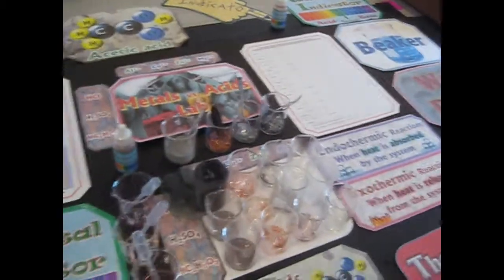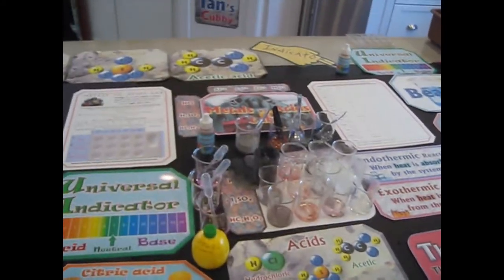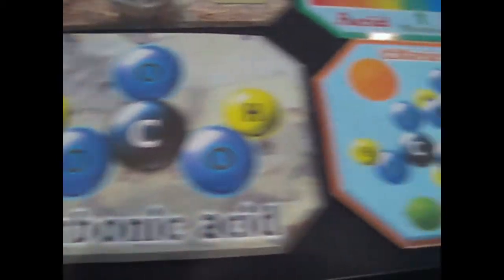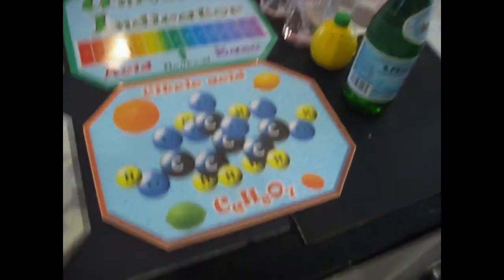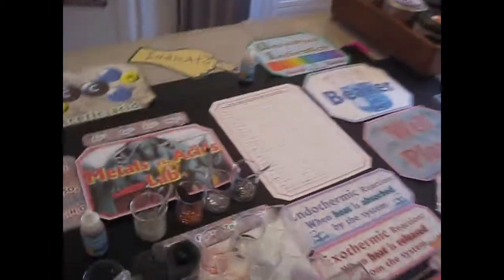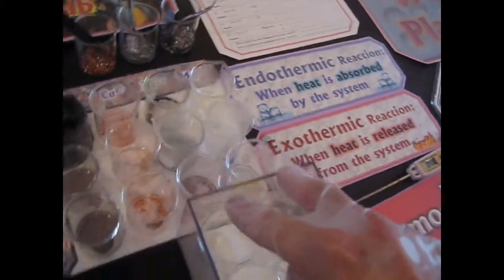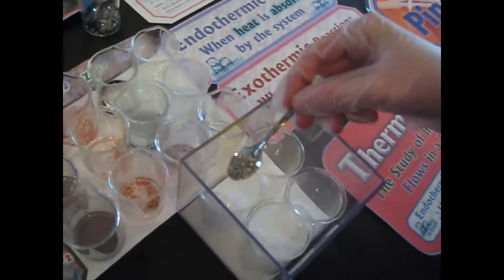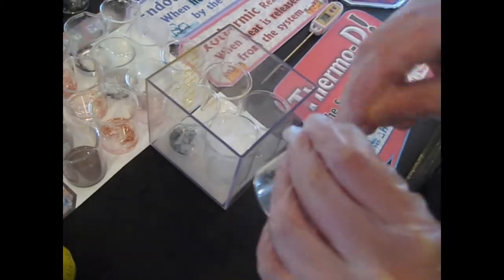So now, as a bonus feature, we're going to do a reaction with some other acids. These are bonus ones. We're going to use citric acid, like lemon juice, and carbonic acid, like Pellegrino. Let's just use two of the metals, the zinc and magnesium, and we're going to carry them down and put them right here. Go ahead and put the metals in the same way. You can pick up the whole beaker. So let's just put the zinc in these two. Oh my god.